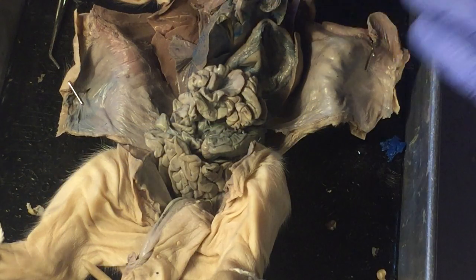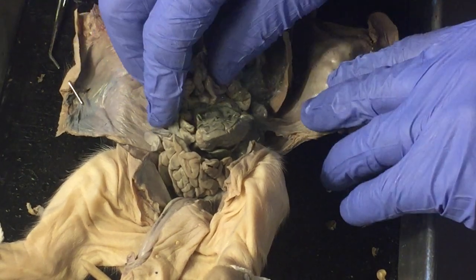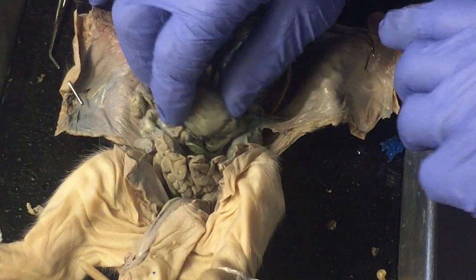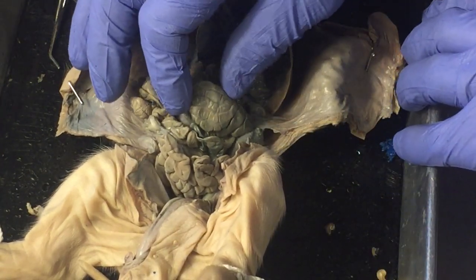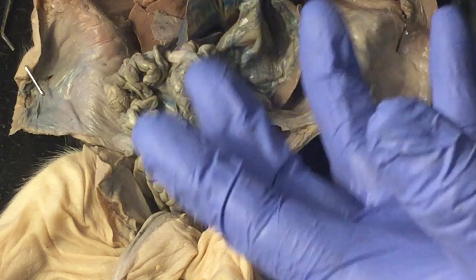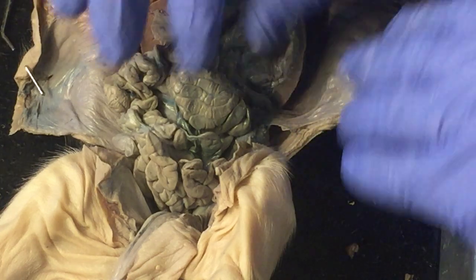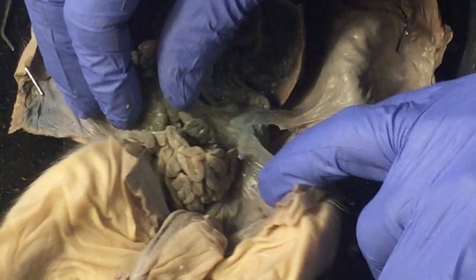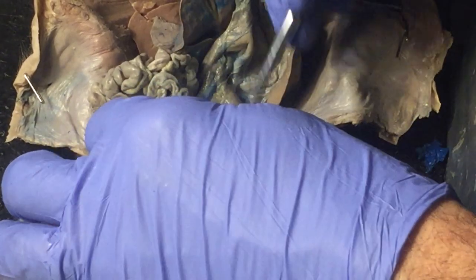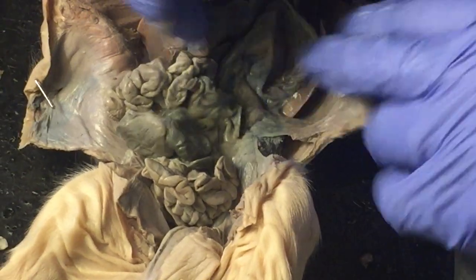So again: abdominal cavity — liver, gallbladder, stomach, spleen, pancreas. Down here we have small intestine; most of what you see here is small intestine. If we spread it apart, you can see the mesentery — two thin layers in a fan shape that hold the small intestines in place. The arrangement of the small intestine is not accidental; here are all the arteries, veins, nerves, and lacteals that take material to and from the digestive tract.